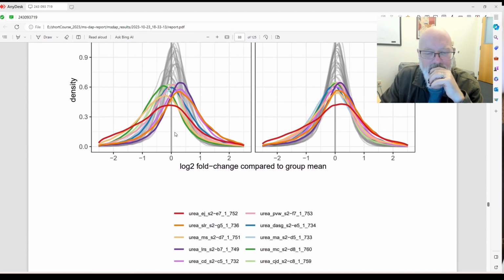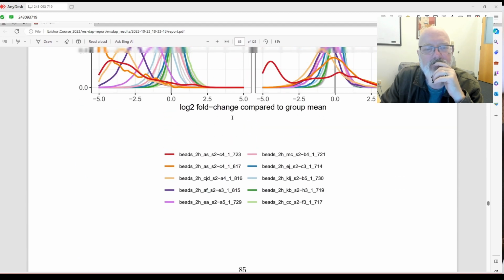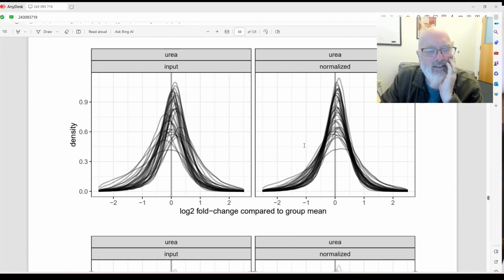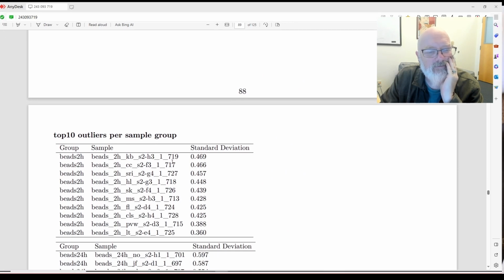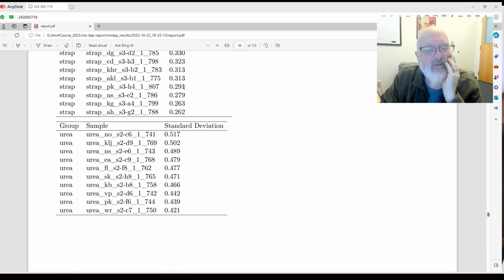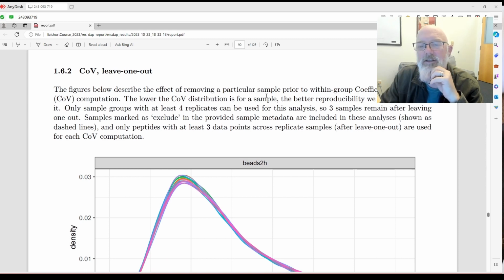Was 723 a 2-hour or a 24-hour? 723 was a 2-hour, right? That looks like an outlier, but maybe because it kind of normalized, I don't know. And so why isn't that in the top 10 outliers? You think it would be? I don't know. But maybe you'd want to pick the top 3 or 4 and remove them, maybe? I'm not exactly sure.